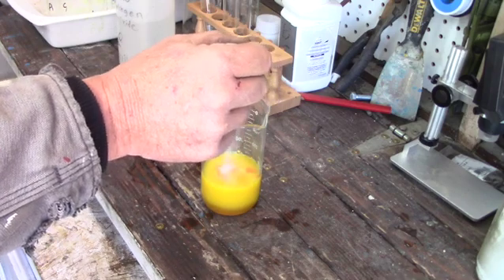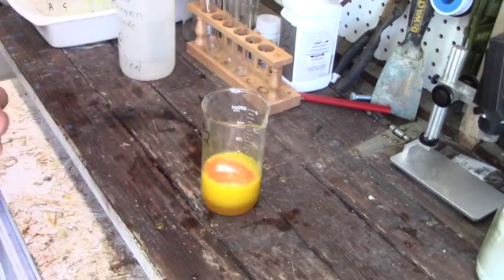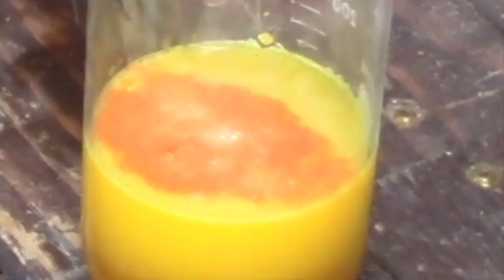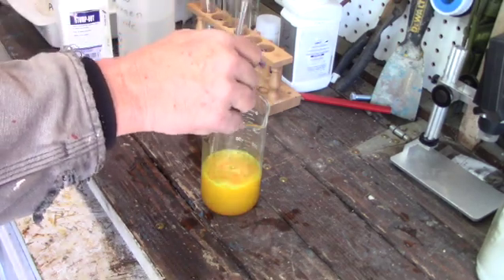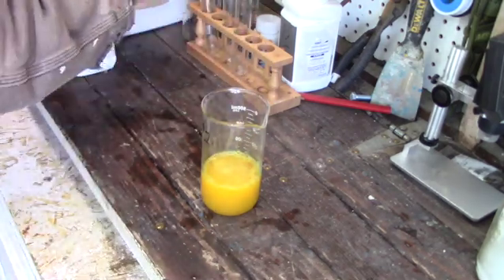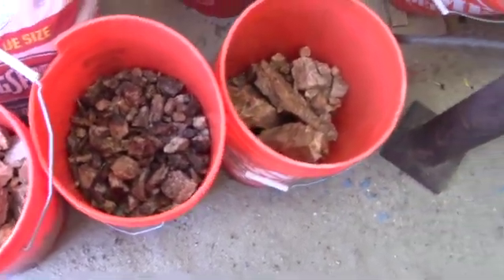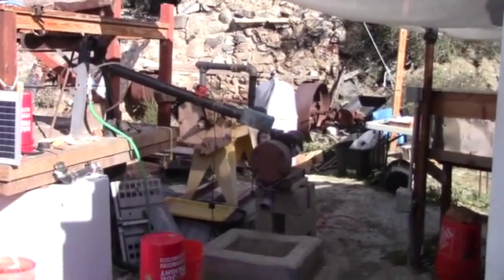For some reason I'm getting this pink material on the top of my solution. I might be overdosing my solution with the SMB. I let this sit overnight and all I got was a white precipitate. But in case there is some gold in there, I am going to take that precipitated material, filter it out, and run it through my furnace in a cupel, just to try and squeeze out any gold that might be there. So the next thing in line is to crush up our good samples of ore and run those through our mill, and we'll process them and see if we can get a big chunk of gold.